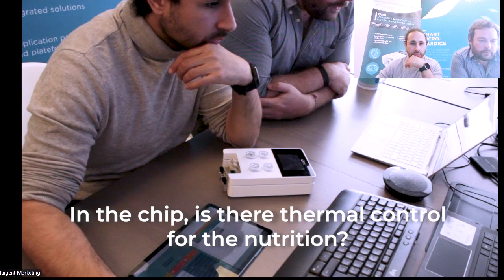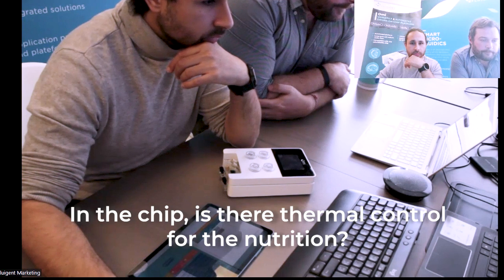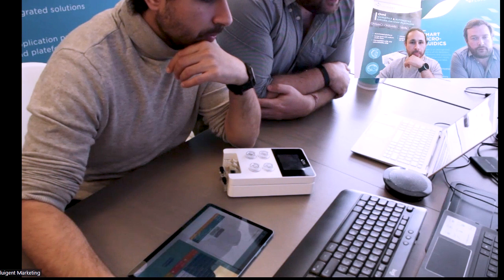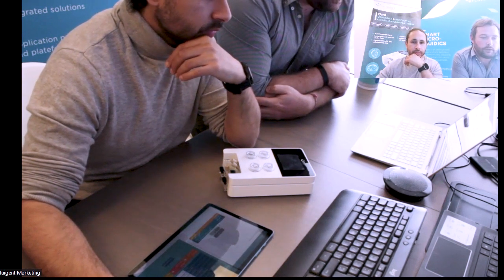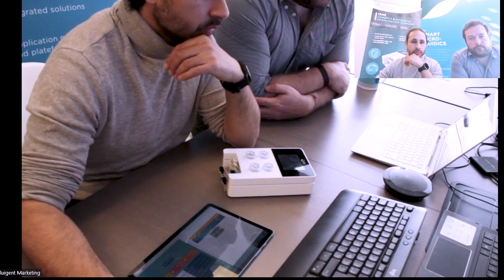Is there a thermal control for the nutrition? So no, OMI is meant to be put in an incubator, but there is no local control. And the 3D architecture in the chip, well, actually it depends on the chip you use.